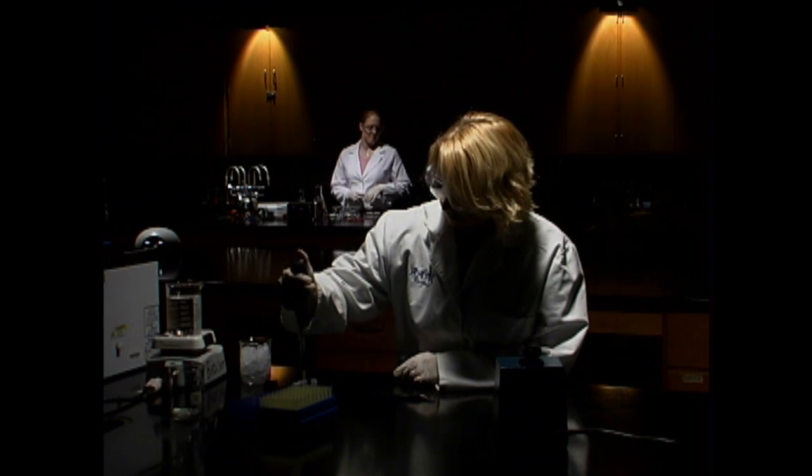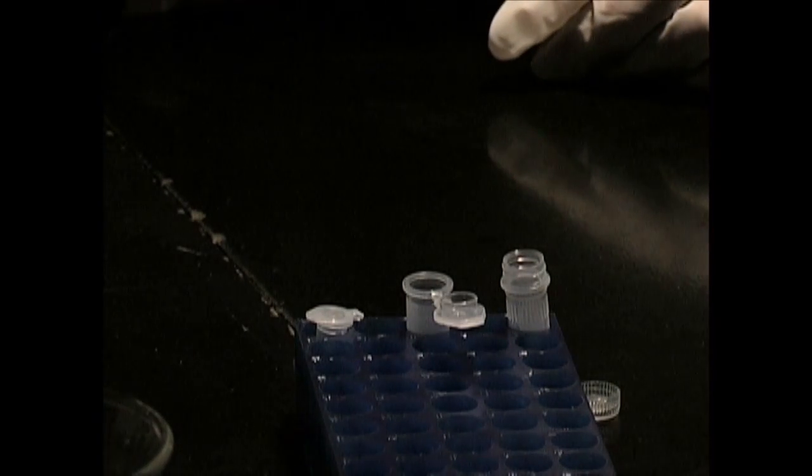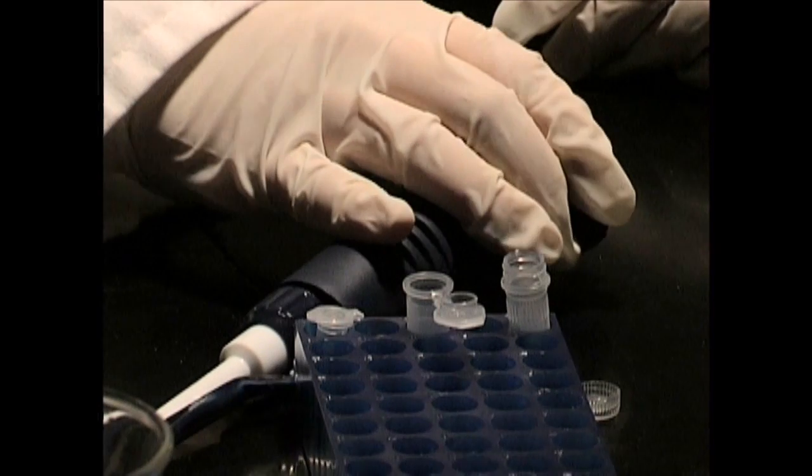Without allowing the solution to settle, pipette 150 microliters and add it to the hair. Make sure the hair is completely submerged.